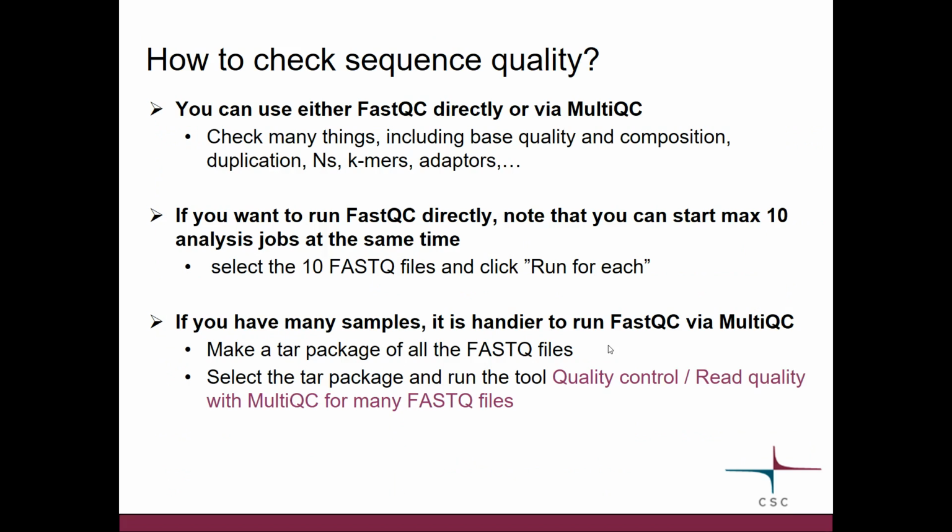So how do you check the base quality in your reads? Well, you can use in Chipster either a FastQC tool, so that you run it directly, or via a MultiQC tool. FastQC checks many things, including this base quality that we just discussed, also base composition, duplication, Ns, k-mers, adapters, and so on. Now if you decide to run FastQC directly, that means that you run it for each individual file. Please note that you can actually start up to 10 analysis jobs at the same time. So you would select your FastQ files, and then the Run button in Chipster would change and it would say Run for each.